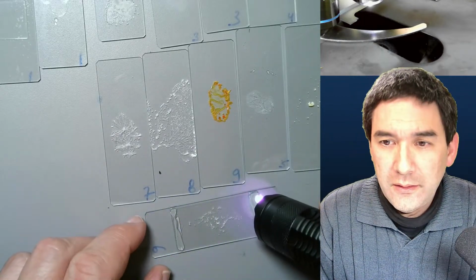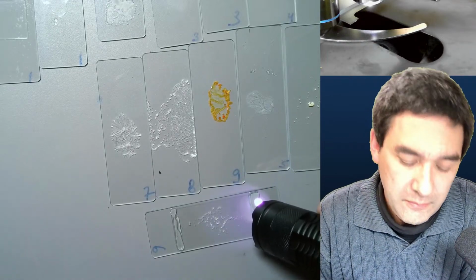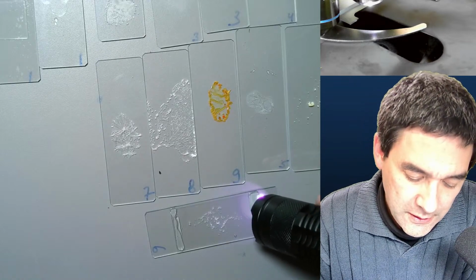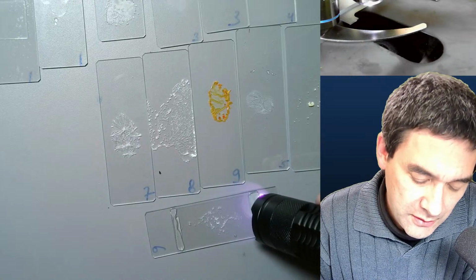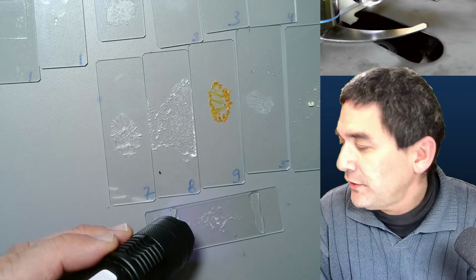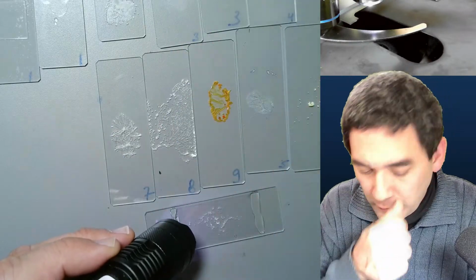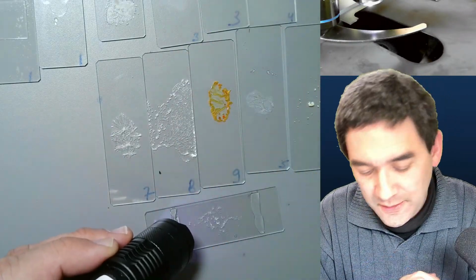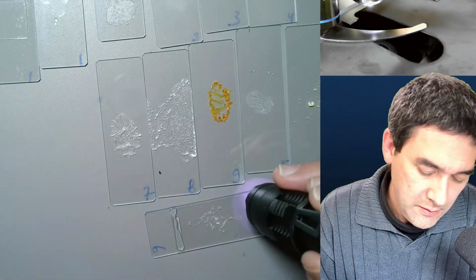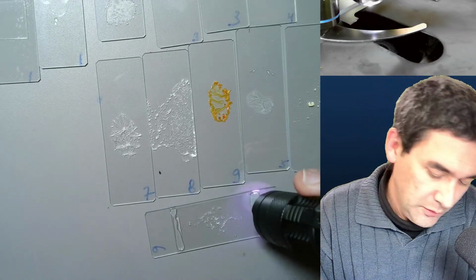Okay, and basically, this is a technique that I'm going to try to explore a little bit more, whether this is actually feasible, because it cures quickly, just in a minute or so. And maybe there are even those devices, look, where you can put your fingers in if you're putting this nail polish on your hands. So I don't know if this is enough or not.